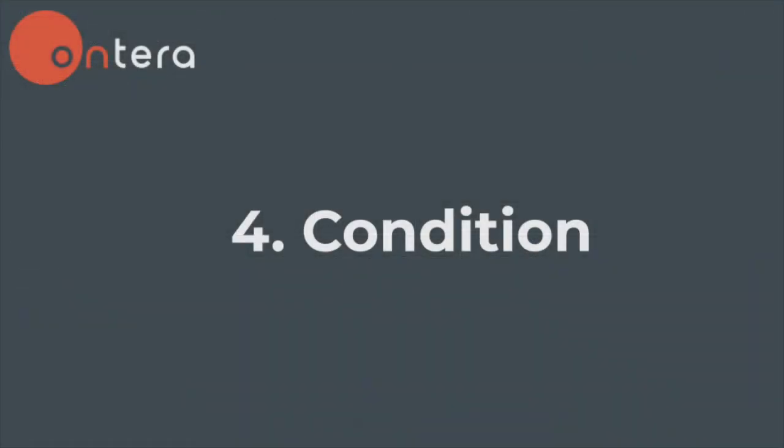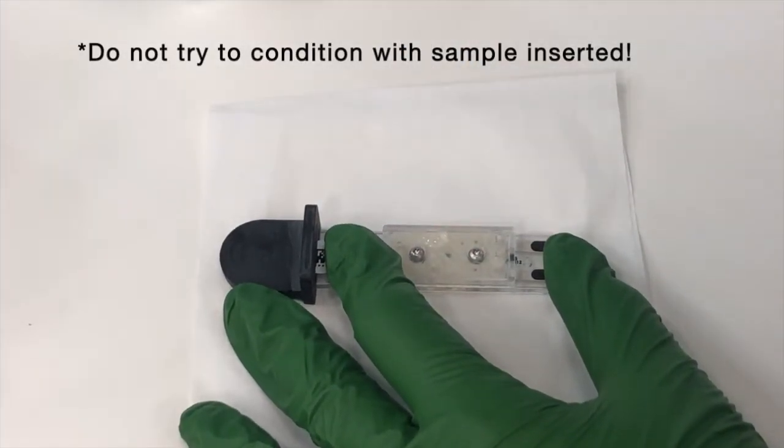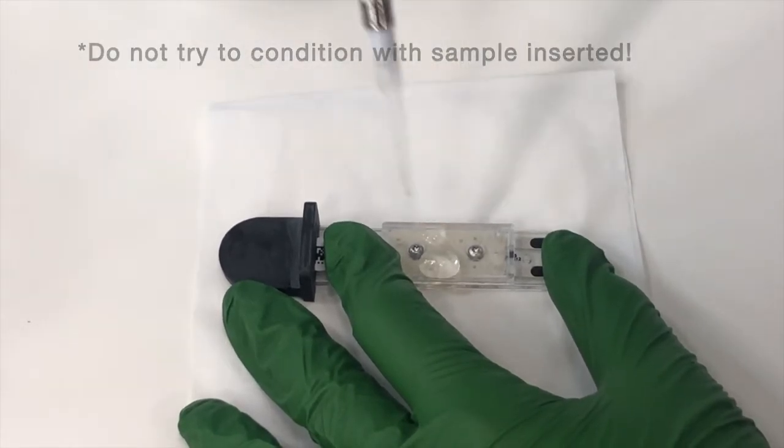If all of the previous steps were not sufficient to clear the clog, as a last resort, conditioning may be used to regain baseline stability. Conditioning is a last resort because it is the technique most likely to change your pore and impact data quality. However, applying sustained high voltage pulses can be very effective at pushing a clog out of the pore. Before you get started, ensure that running buffer is flushed into both channels of the test strip.